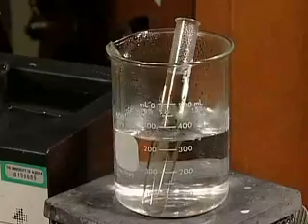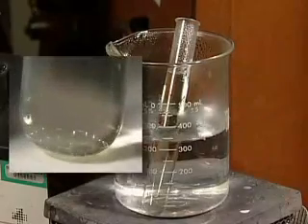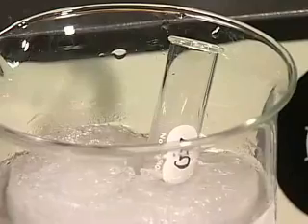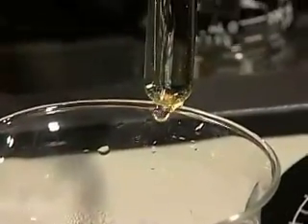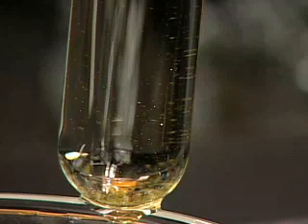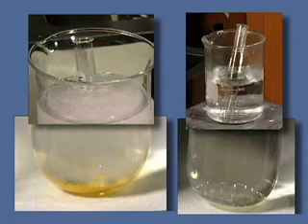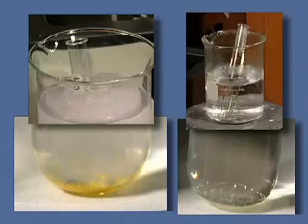Observing the sample in the boiling water bath reveals that very little, if any, solute has come out of solution. However, in the ice water bath, a substantial amount of lead-2-iodide crystallized out of solution. It appears that the solubility of lead-2-iodide is less at lower temperatures.